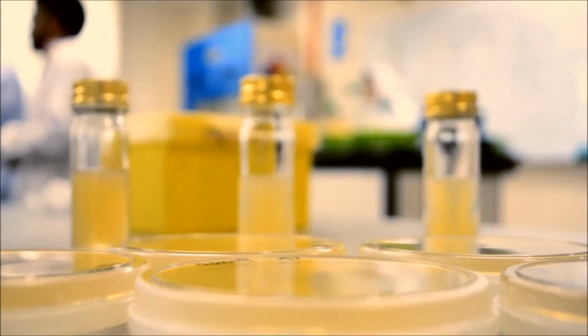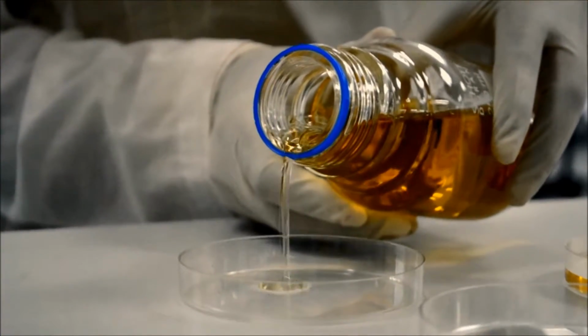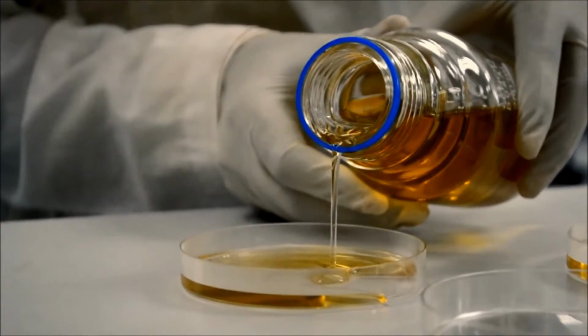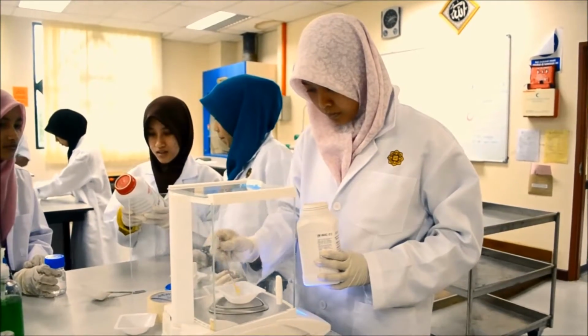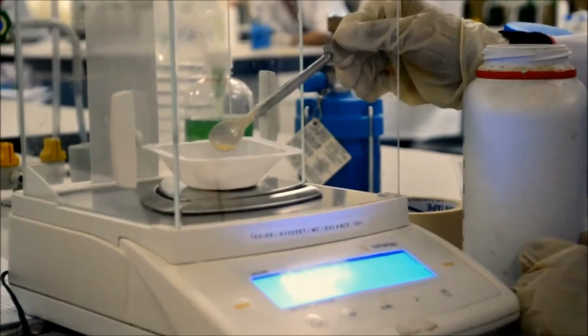There are differences between agar media and nutrient broth. Agar media are prepared using nutrient agar powder, whereas nutrient broth media are prepared from tryptic soy broth powder. Three physical forms of culture media are liquid media, semi-solid media, and solid media. Solid and semi-solid media contain a solidifying agent, whereas a liquid medium does not.